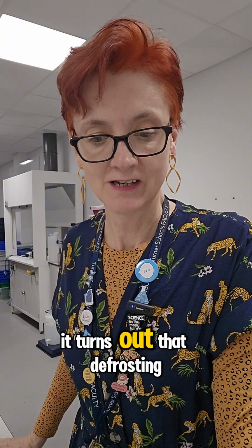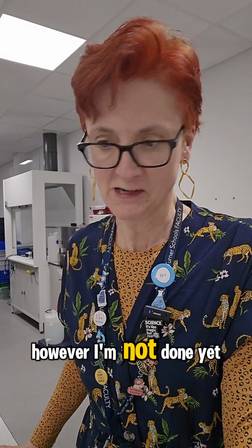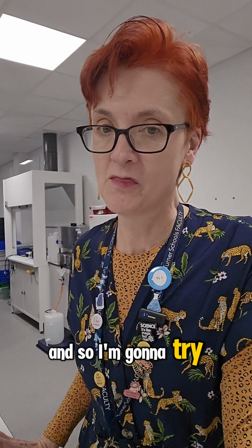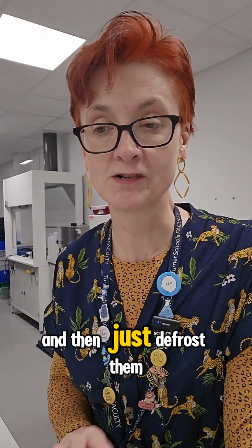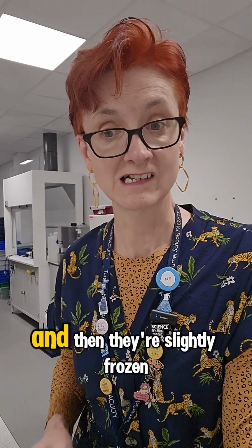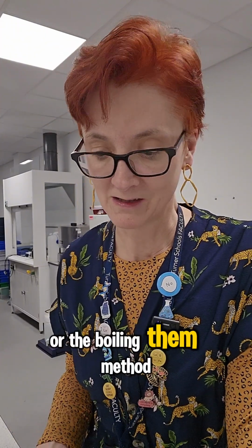It turns out that defrosting the brains overnight in a saturated salt solution does work. However, I'm not done yet because somebody else has ordered this for next week. And so I'm going to try a third method, which somebody told me, which was keep them frozen and then just defrost them for 30 minutes before the practical. And then they're slightly frozen and still firm, which obviously will be a lot less effort than the saturated salt solution or the boiling them method.